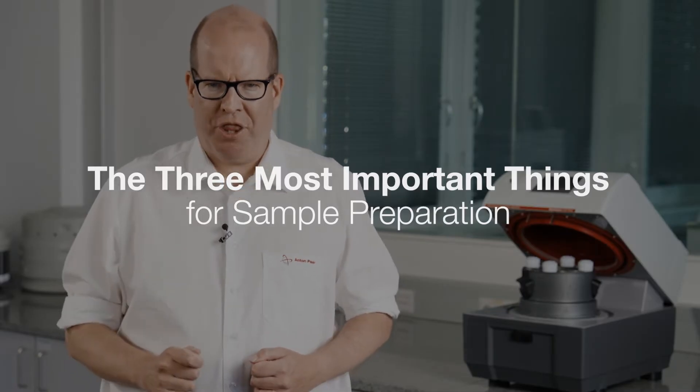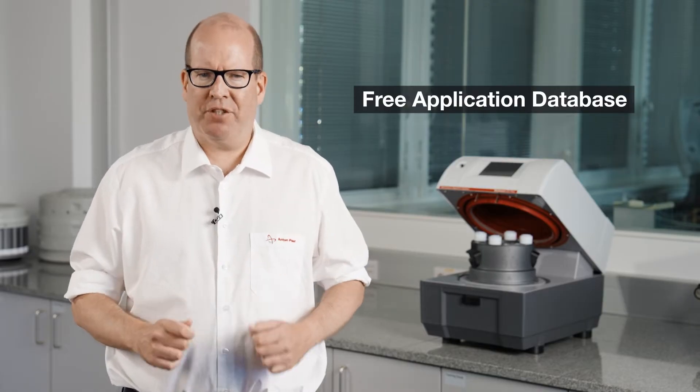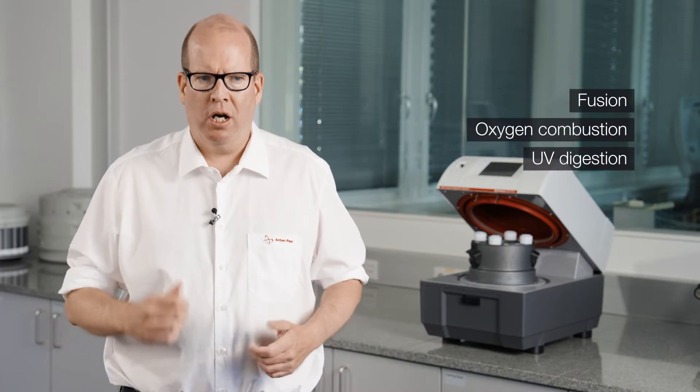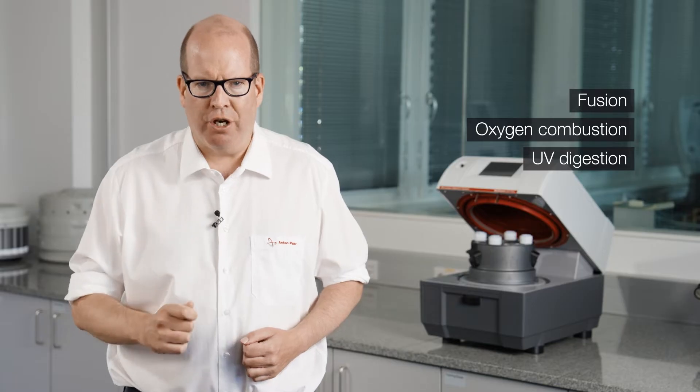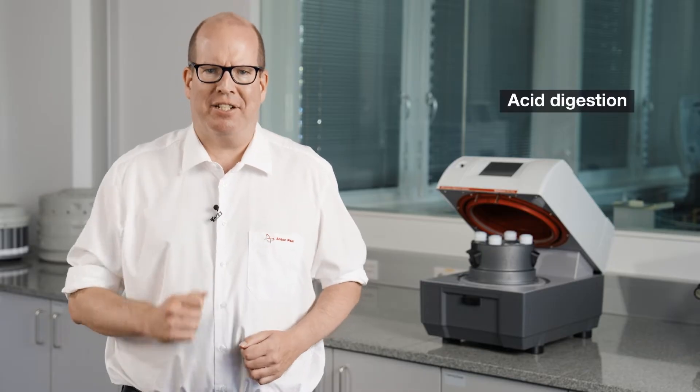In this video, you'll find out what the three most important things are that you need for successful sample preparation prior to ICP-MS analysis. You'll also get a link to a valuable database for preparation of individual samples. There are different methods of sample preparation such as fusion, oxygen combustion, and UV digestion. Today though, we're going to focus on the most important and commonly used one: acid digestion.